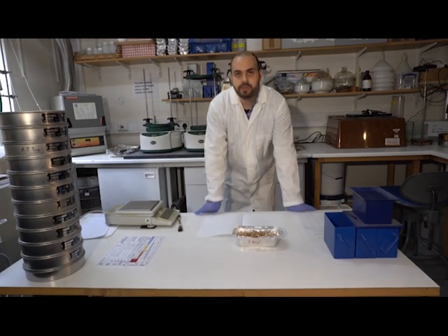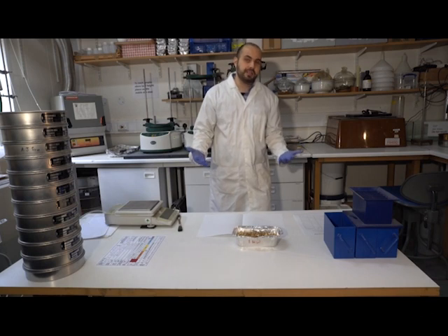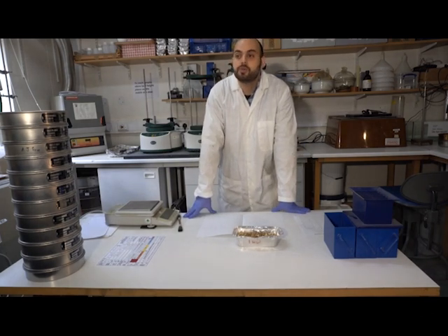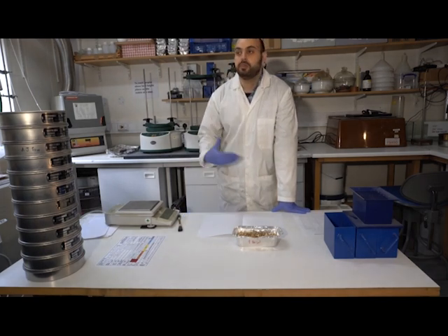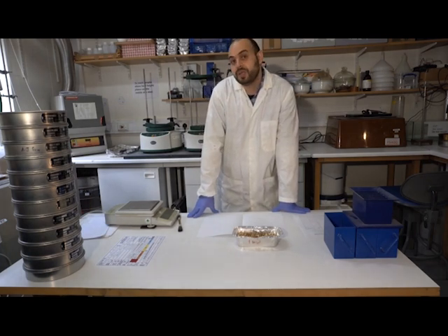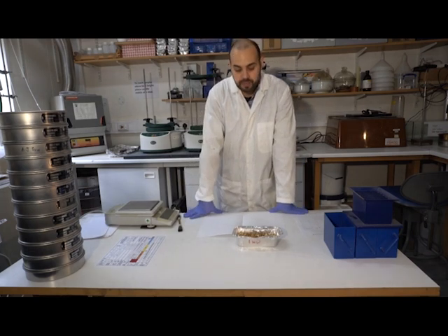Hello. In this video, I want to show you how we can analyze sediment or soil samples to construct their particle size distribution curve, which will allow us to characterize these sediments statistically. For example, describe the median grain diameter, D50, or the mean grain diameter, and look at their sorting, skewness, and kurtosis.